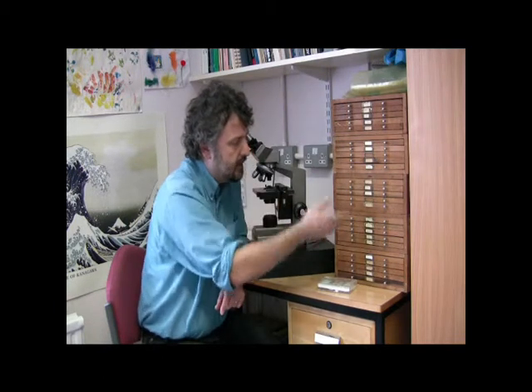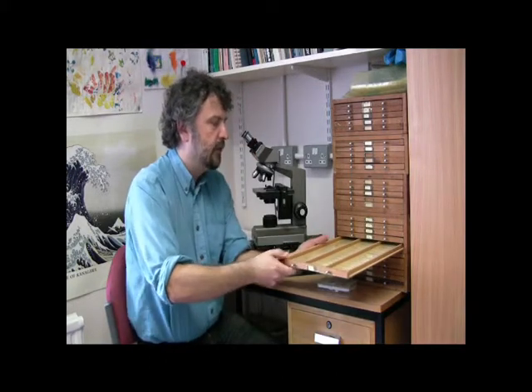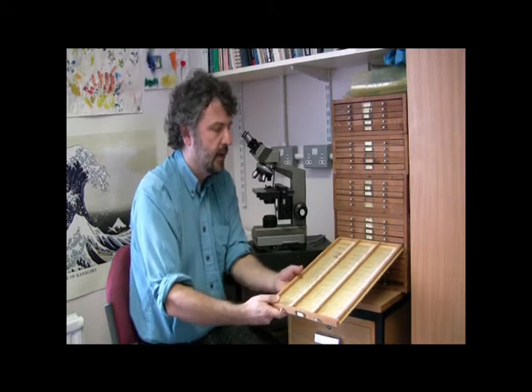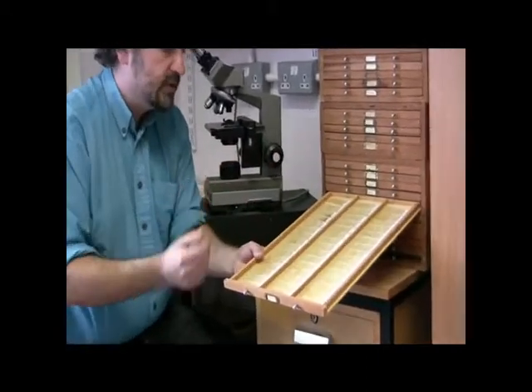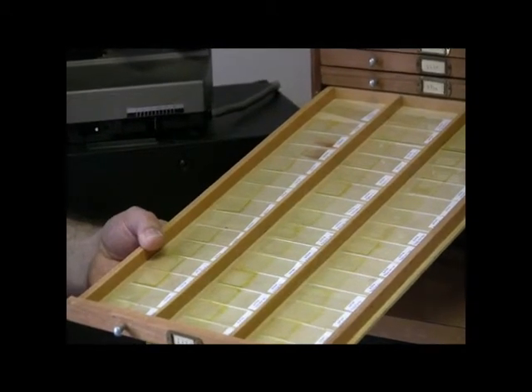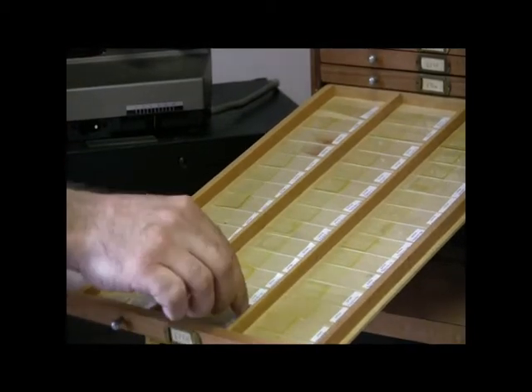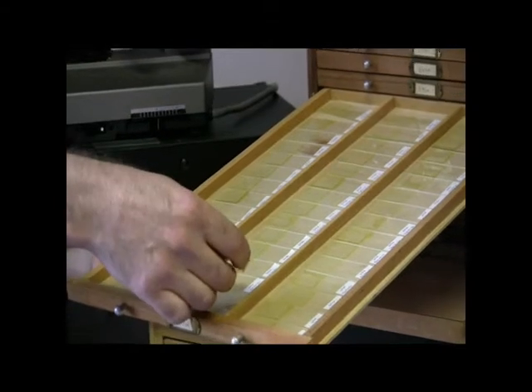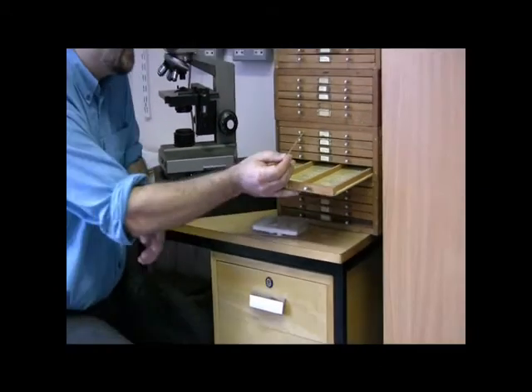Often there is a light intensity control as well, which is this sliding button down here on the right. So that's the microscope, and we would want to place the microscope slide on there. In this stack of microscope slide cabinets, I've got my collection of Ocean Drilling Programme radiolarian slides that I've worked on as part of my own research. This particular tray, which I've just pulled out at random, is from Ocean Drilling Programme Site 677 from the Eastern Pacific Ocean. I've got many samples from this site spanning several hundred thousand years, and I'm just going to take one out at random and put it under the microscope.